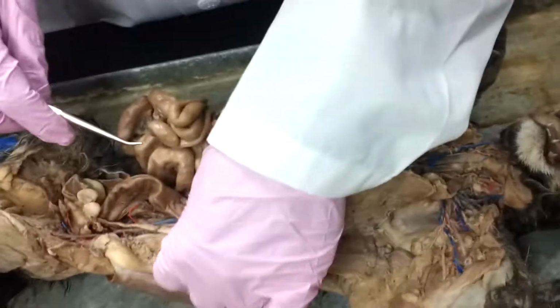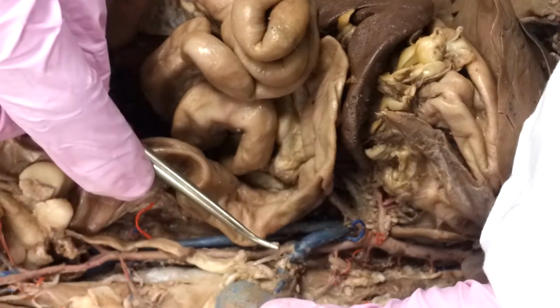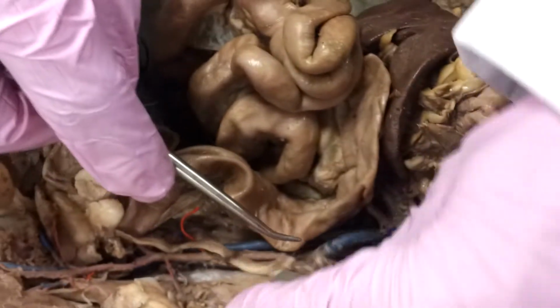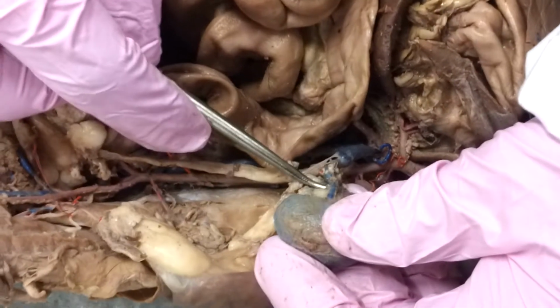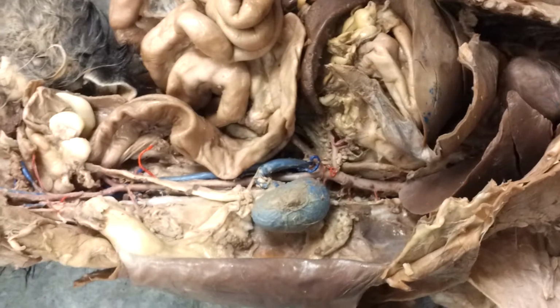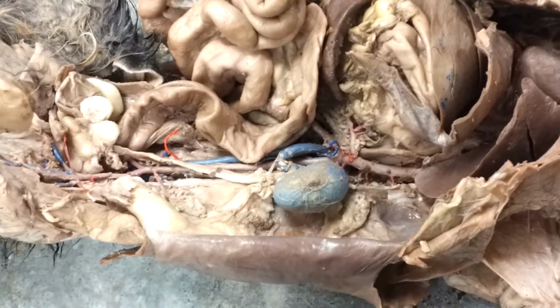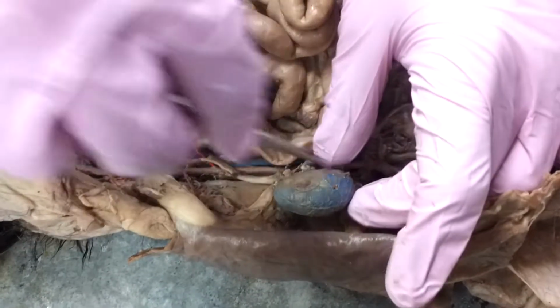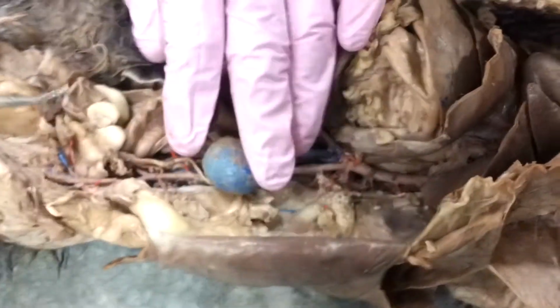Next, what we've got here, we've got our kidney. And again, what we don't see here is a renal artery, but we do see a renal vein. But it's pretty safe to say that if there's an artery going right to that kidney, you're going to think it's the renal artery or vein, right? So again, one of the nice things about doing the actual arteries in the organs is just pulling on the organ, and you'll be able to find out where the artery or vein is. What's superior and medial to the kidney is going to be our adrenal glands. So let's see if we can find that.